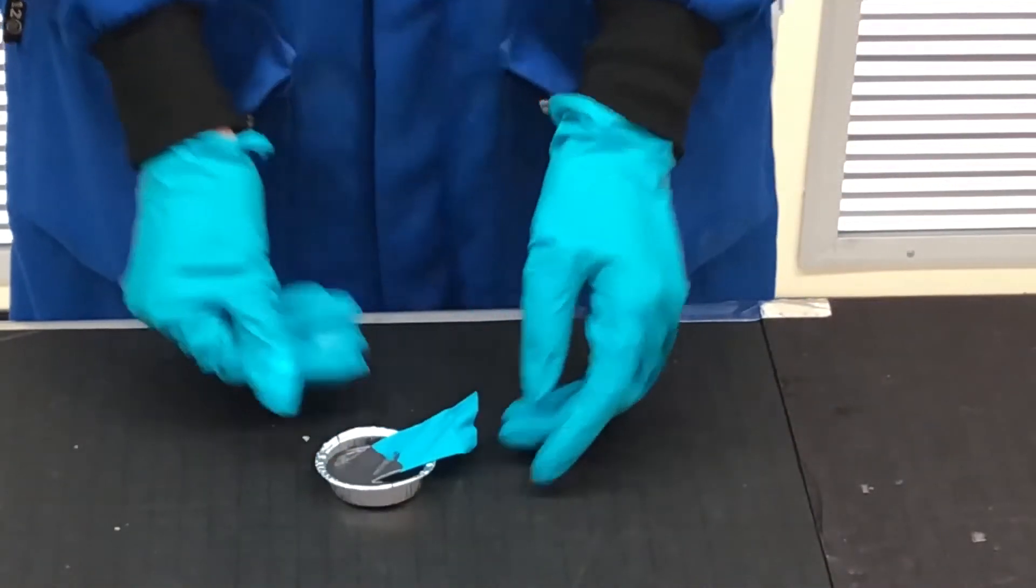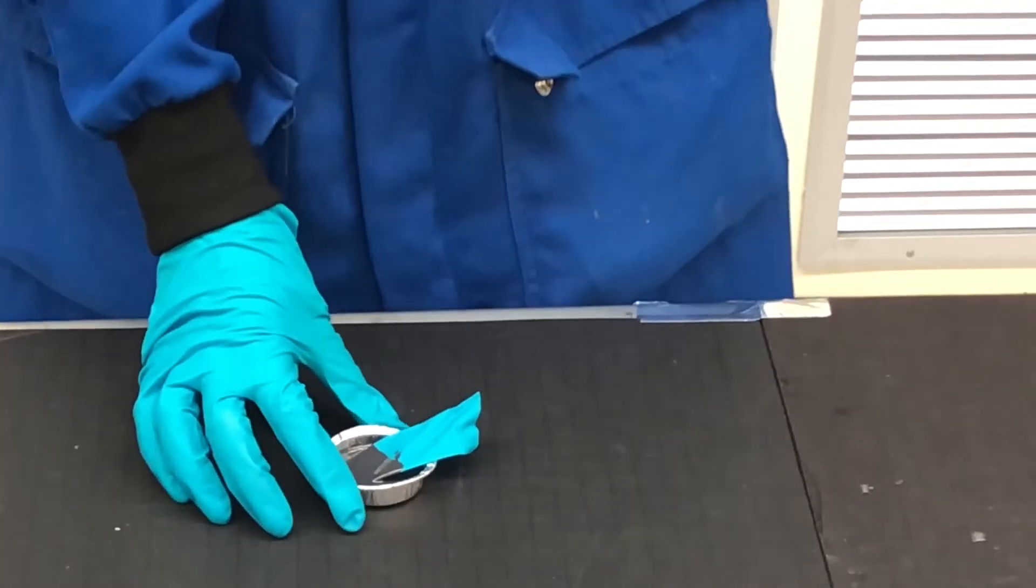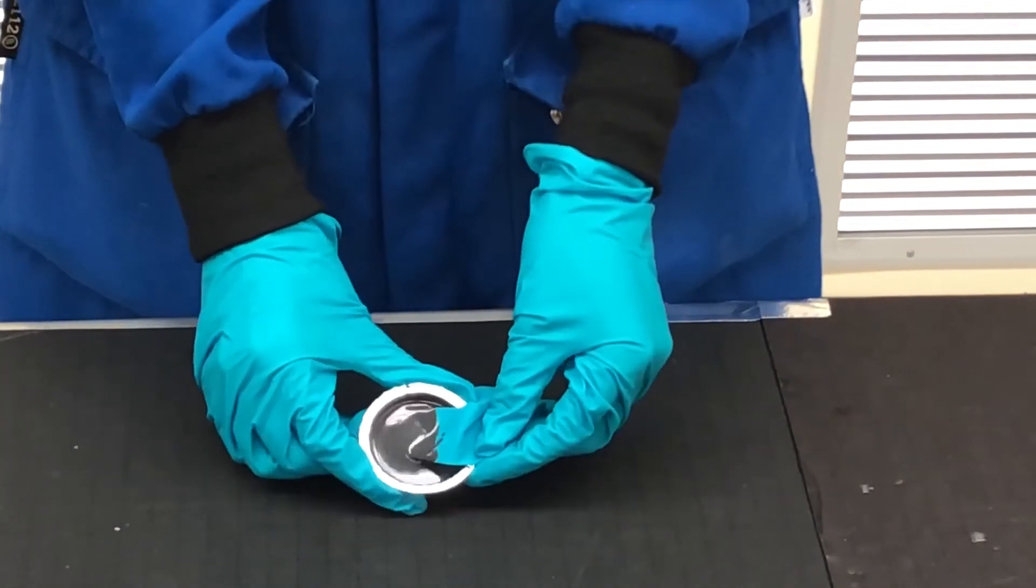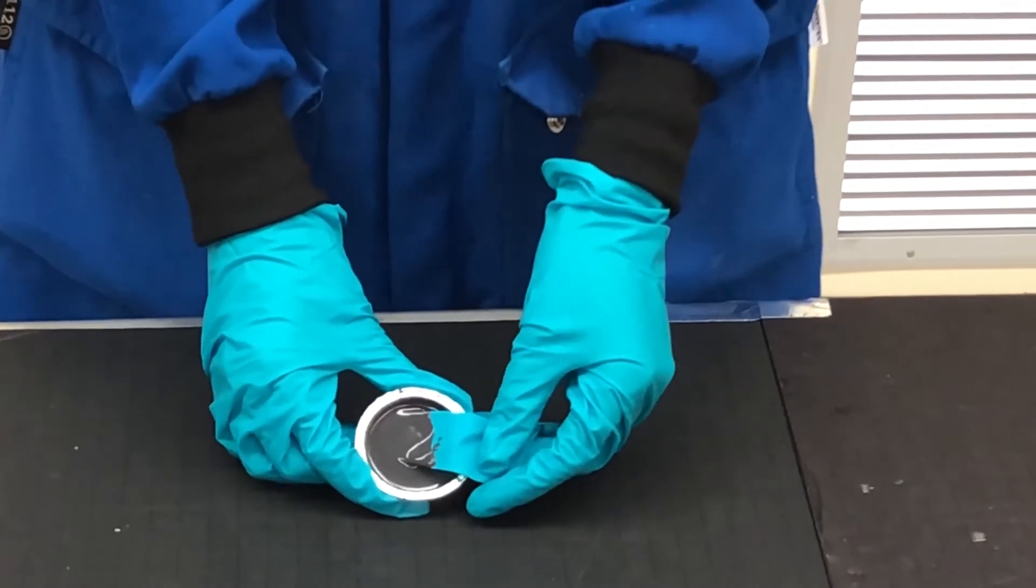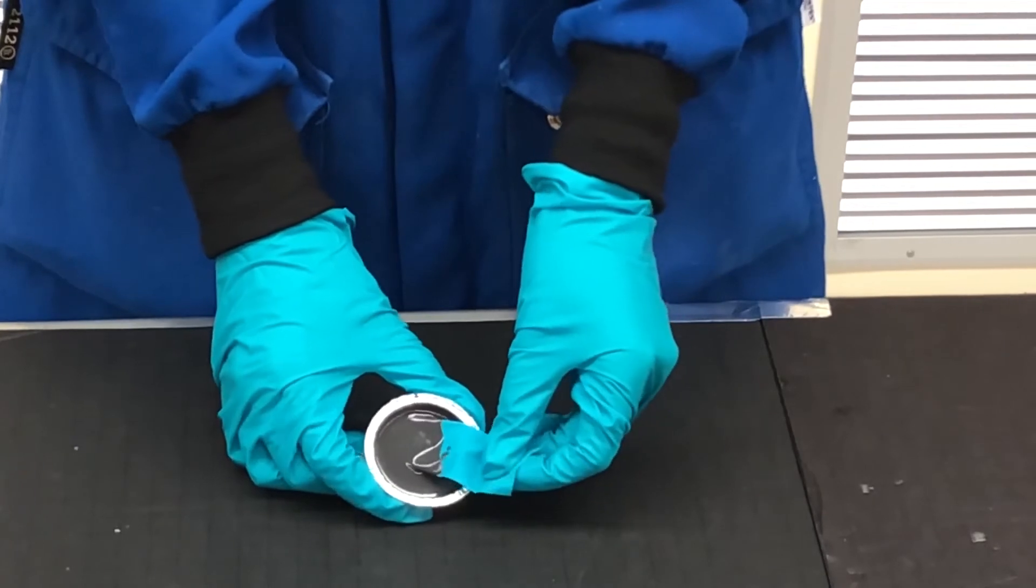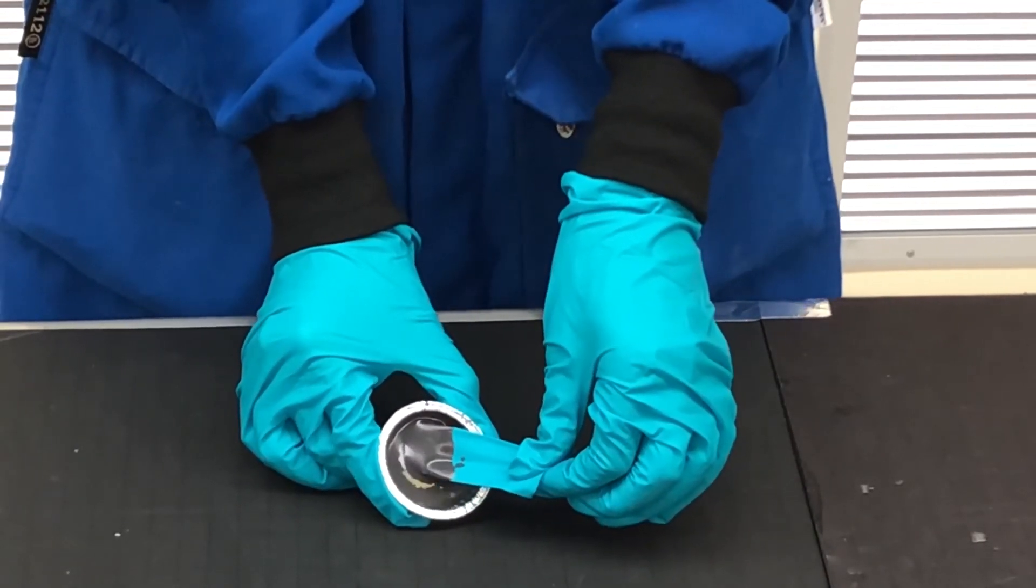To further investigate, each sample can be inspected for other evidence of cure inhibition. If the material is fully cured everywhere as expected, it's a good indication that no cure poisoning is happening. Also, explore by pulling on the sample to see if there is good adhesion if the product should have that attribute.